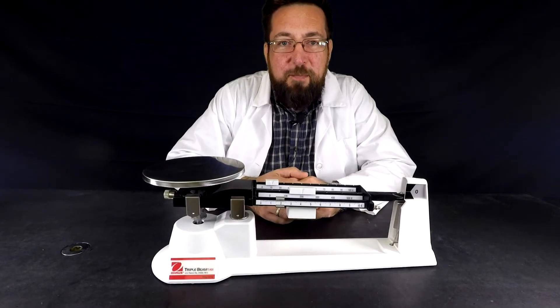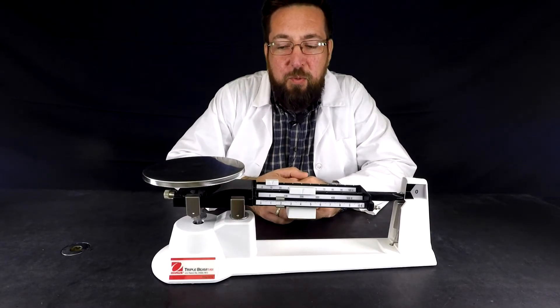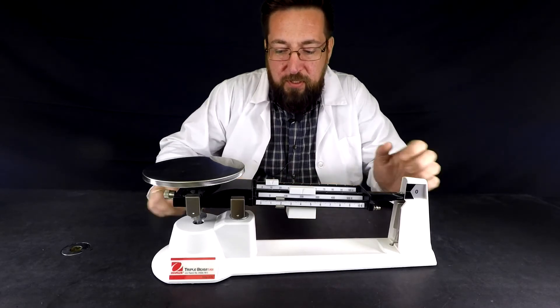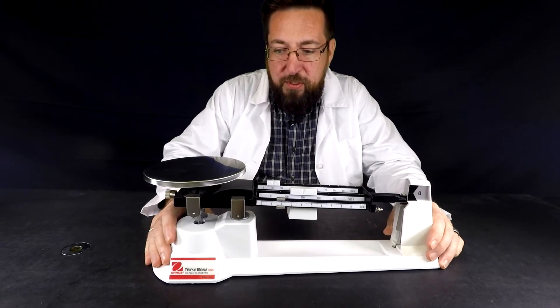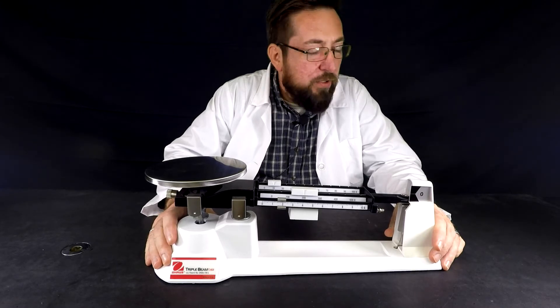Hello science friends, Mr. Paquette here. I'm going to show you how to correctly use a triple beam balance today. So here's my triple beam balance. It's used for measuring mass and I have a couple of important parts that I want to show you.